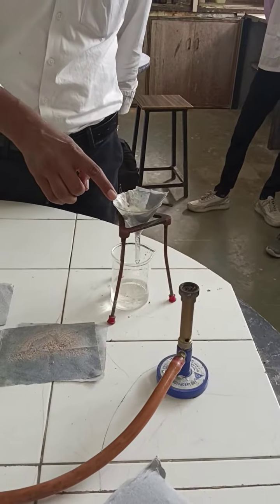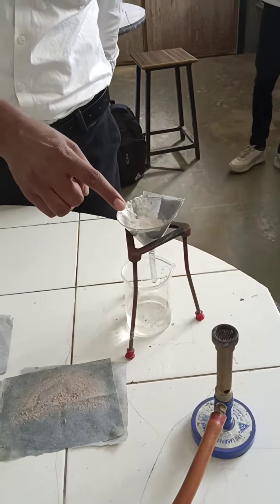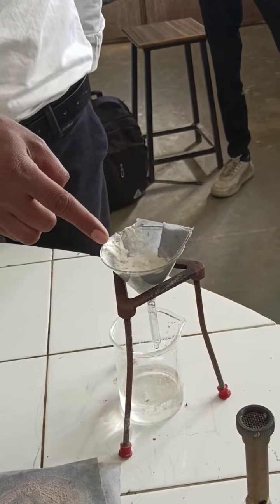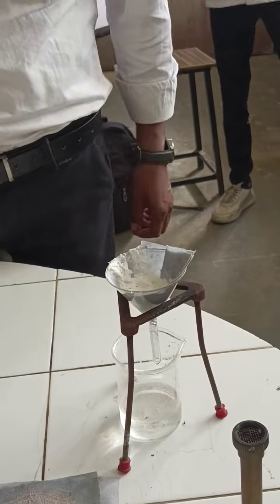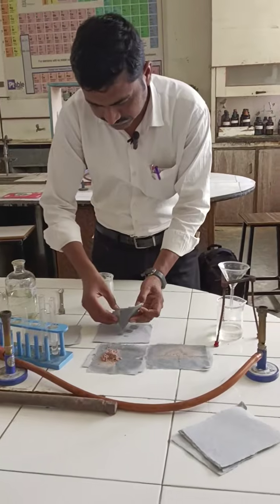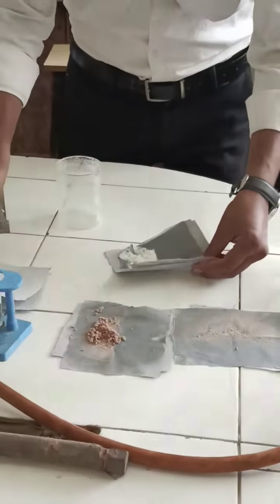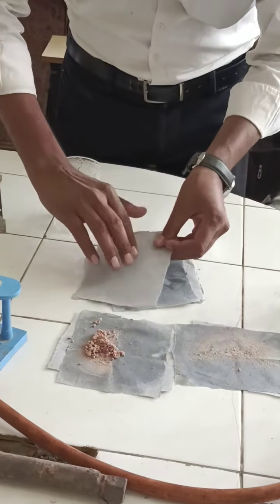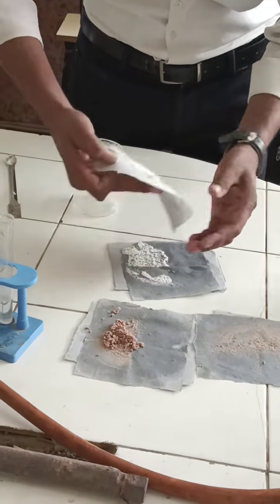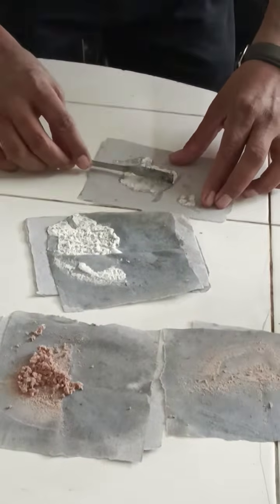You can see the other compound which is reprecipitated as a solid, that is the acid. And this is the filtrate. It does not contain any compound, so the compound is present here, reprecipitated after addition of hydrochloric acid. Now we can take out this compound and dry it by pressing with filter paper, which absorbs the water. With the help of a spatula you can take it out.